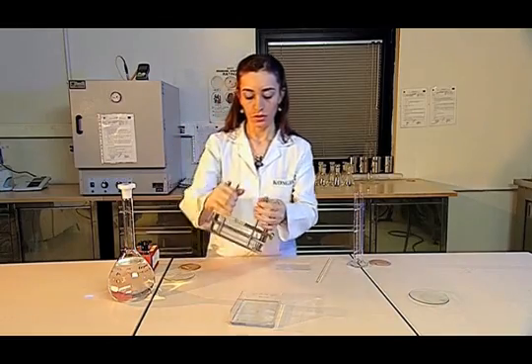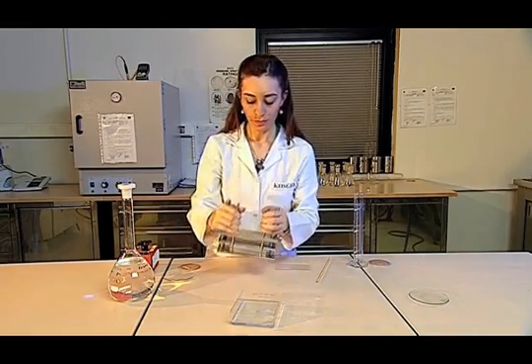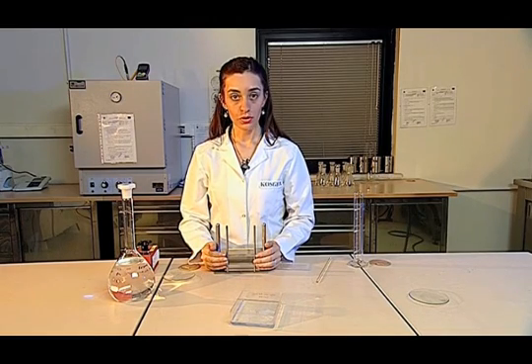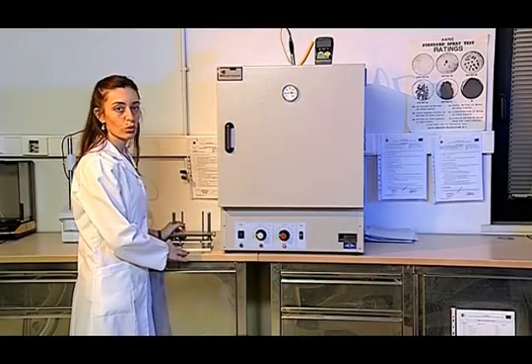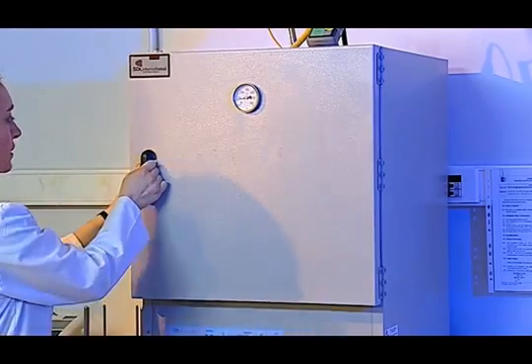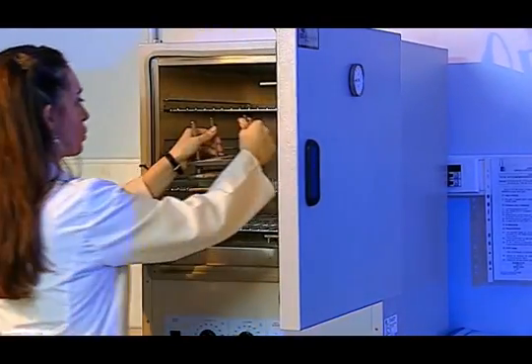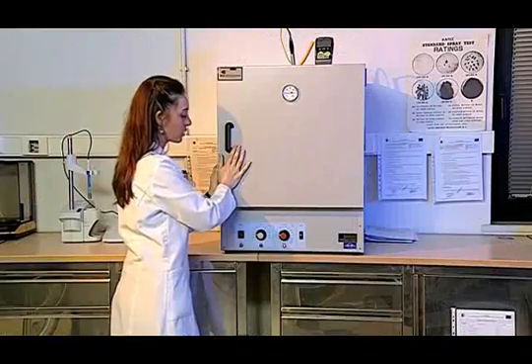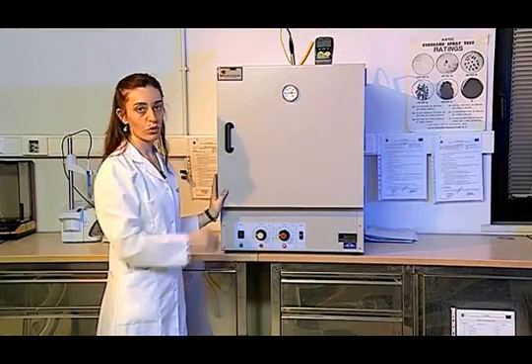In this way, the excess water is filtered, and then the sample is put in the drying oven that has been preheated at 37 degrees centigrade for 4 hours. The sample is placed vertically into the oven previously adjusted to 37 degrees centigrade. The oven must be closed quickly to prevent the temperature from falling, and then we wait for 4 hours.